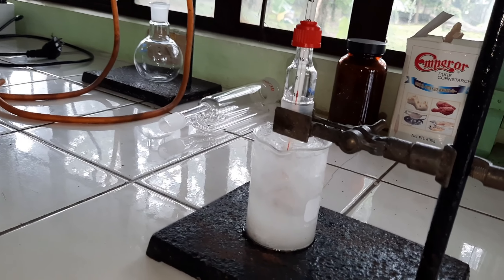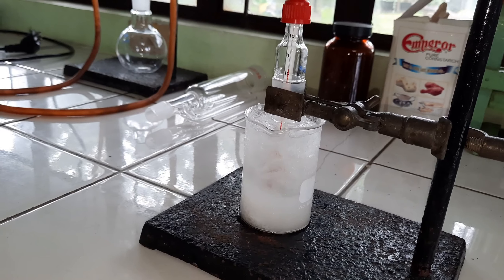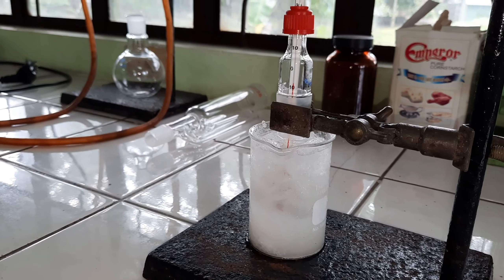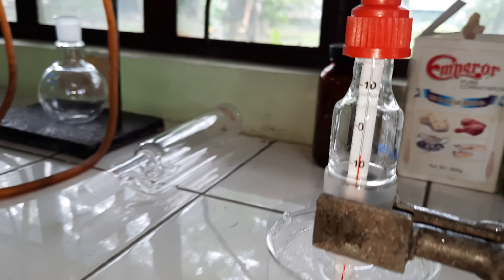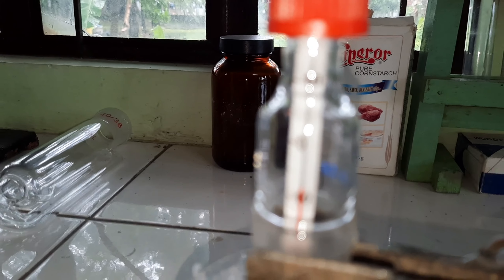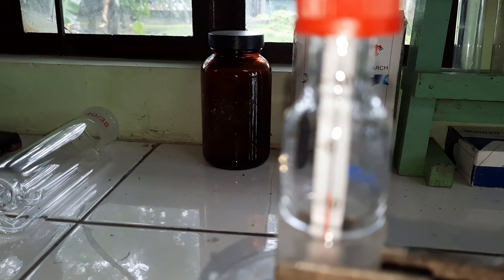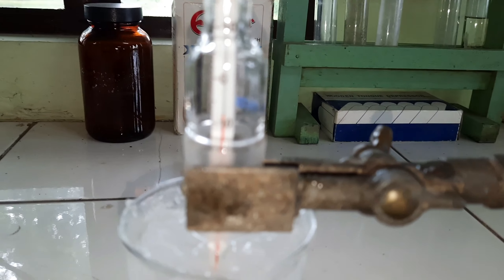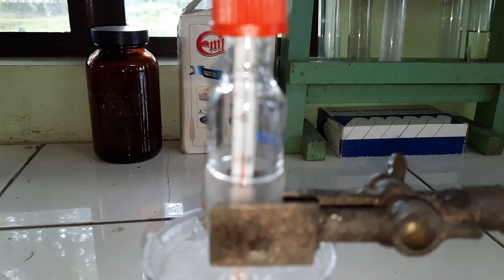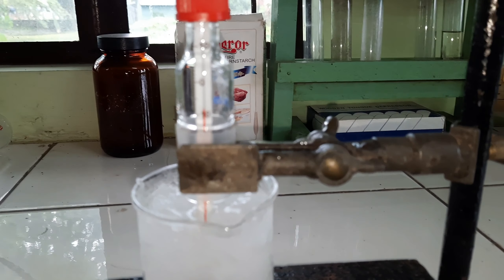Now we are witnessing the freezing point of water as solute particles in the form of sodium chloride are added into freezing water in the form of ice. At this point, the temperature has gone down to negative 8 — that is way below 0. That is way colder compared with simply water; that is water with solute crystals of sodium chloride.